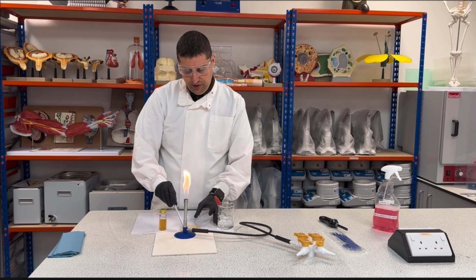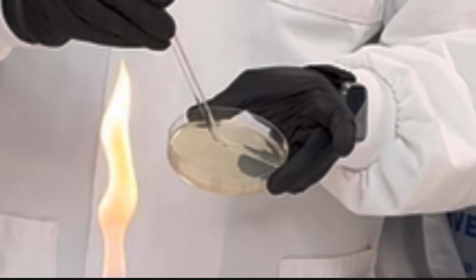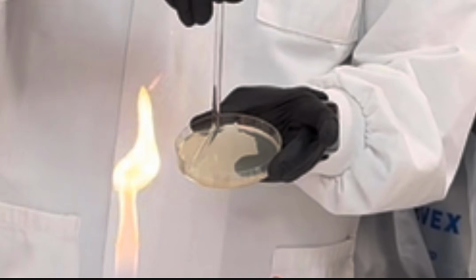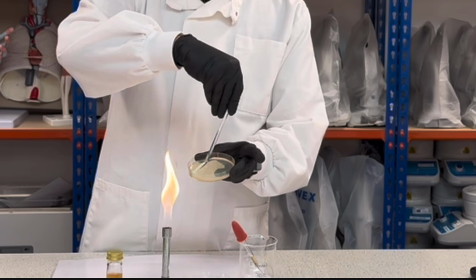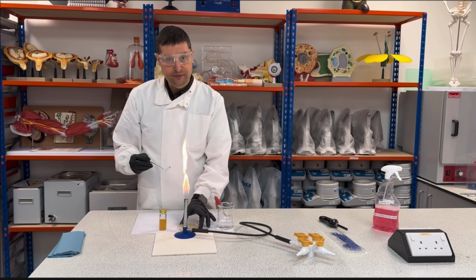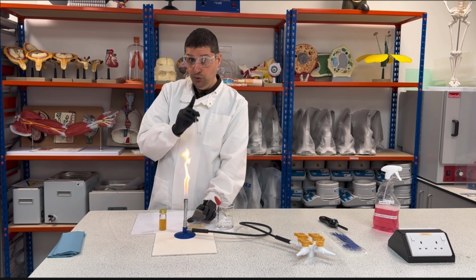Okay? How are you gonna do it? I'm gonna show something that's not right, but just for demonstration. So that's the movement you're gonna do. Spread everywhere. Okay? Spread everywhere. But when you're doing it, it's better if you do it here, with the cover in the top, facing you.